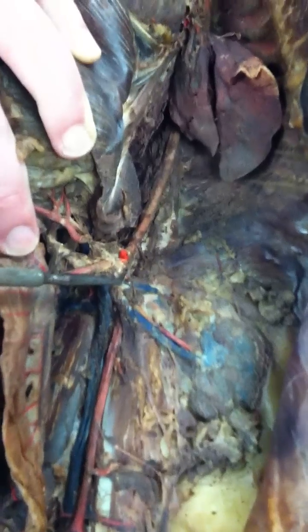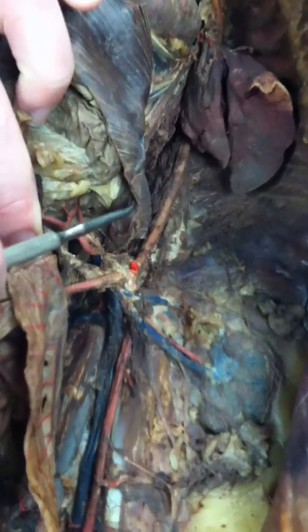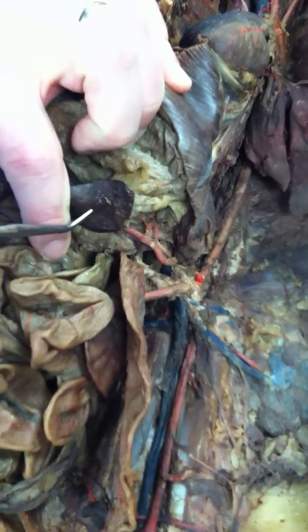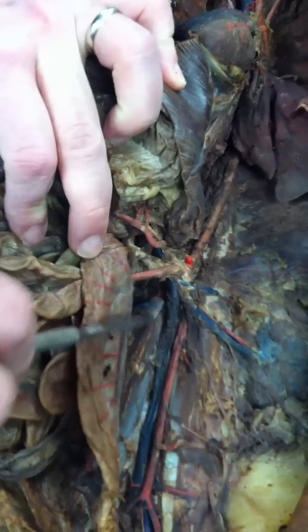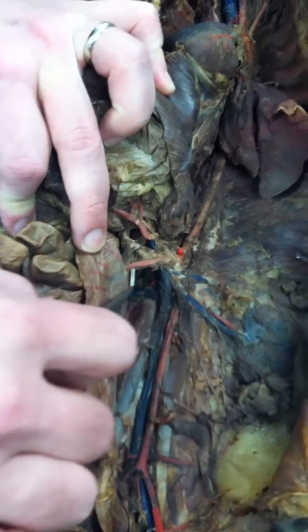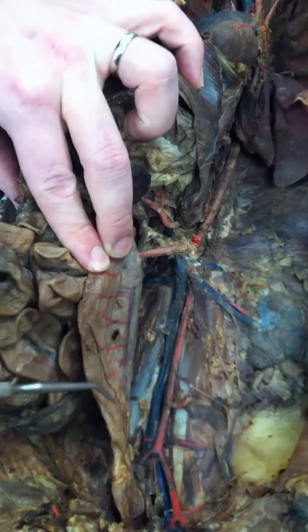Right here you can see this broken red spot — that's the celiac trunk. Of course it's broken, so it's hard to say what's what. You can see a little bit of splenic artery coming up here because it's going to the spleen, which I flipped over to the other side. You can see the superior mesenteric artery right here going towards the mesentery, this flap of tissue which brings blood vessels to the small intestines.